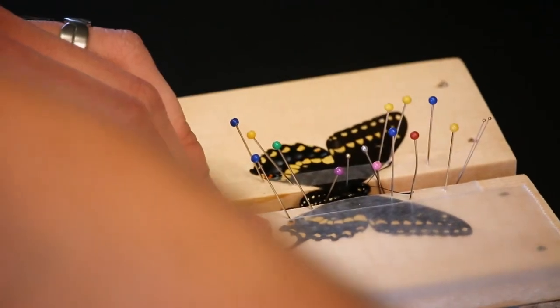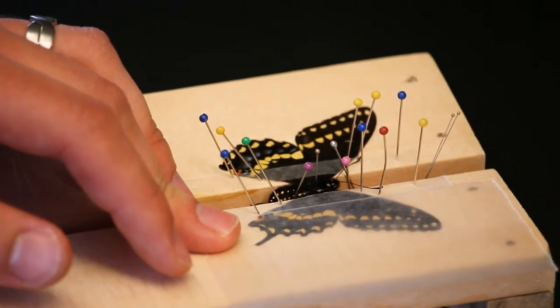This last step is laying a much wider piece of wax paper down to hold the outer edge of the wings that are not covered with the thin strips. Next you pin it down against the spreading board surface.